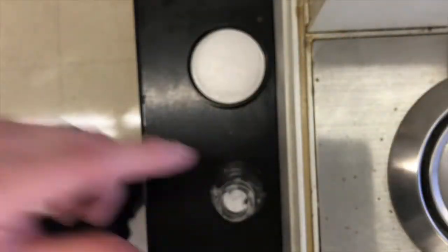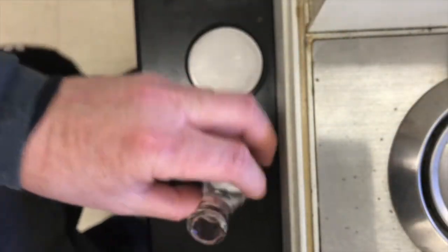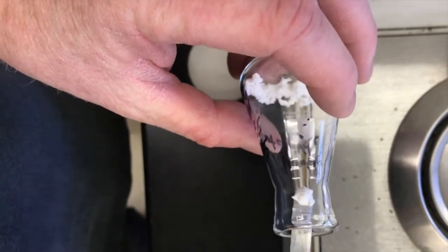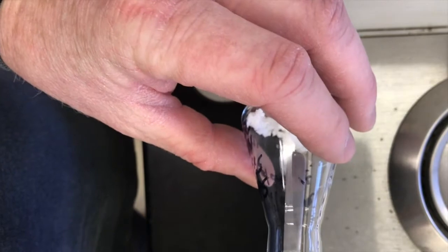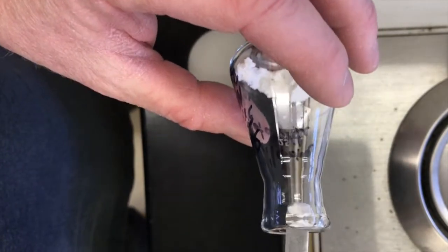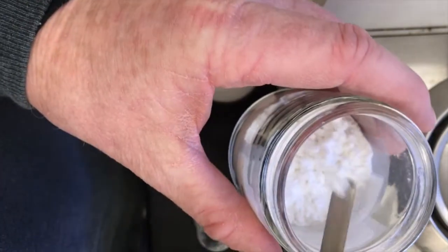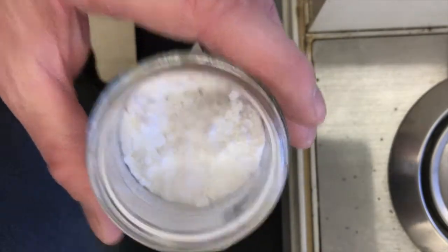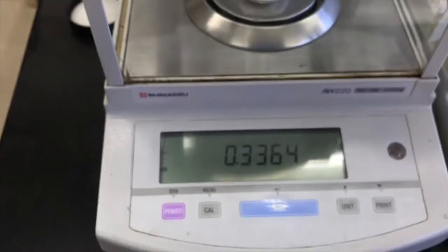It's not too bad, but I'm gonna remove some because I feel like I want to get closer to 0.3. So what should I do? Should I take this out and put it right in the waste bottle? Nah, I know that this Erlenmeyer flask is clean, my spatula is clean, and also that this is impure sulfanilamide. I'm putting it back into the impure sulfanilamide bottle. So it's not like I'm gonna make this that much more impure. It's fine. I'm not just throwing it away without thinking it over first.